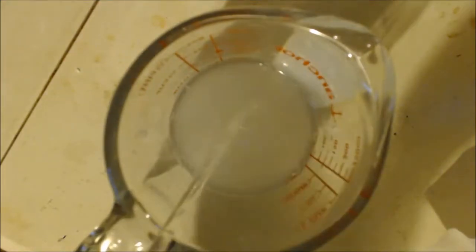Still fizzing. I'll let it sit for a while. Now I'm getting a pH of about 8, so I'm going to dump in the rest of the acid. I shouldn't have put it in the refrigerator — it's all cold.